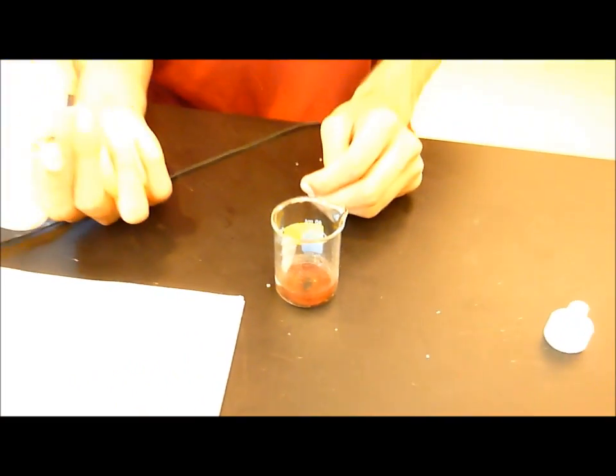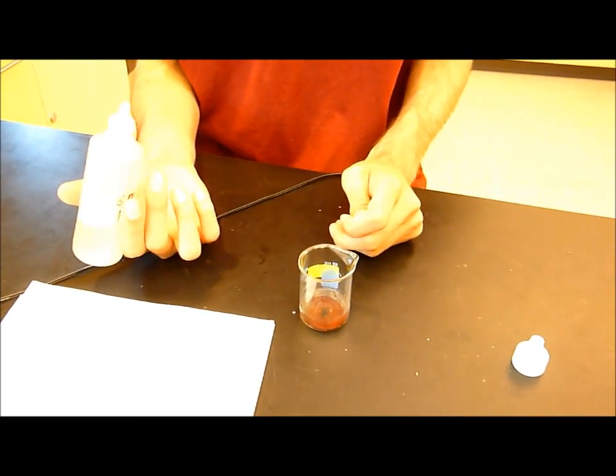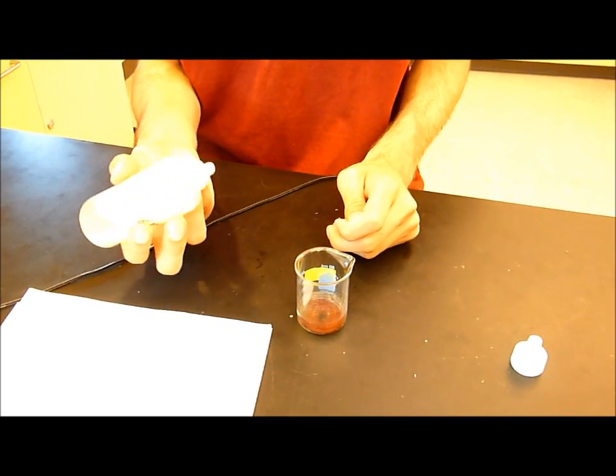Add five drops of six-molar hydrochloric acid to the solution to dissolve any insoluble aluminum salts in the mixture, which should make the solution clear.